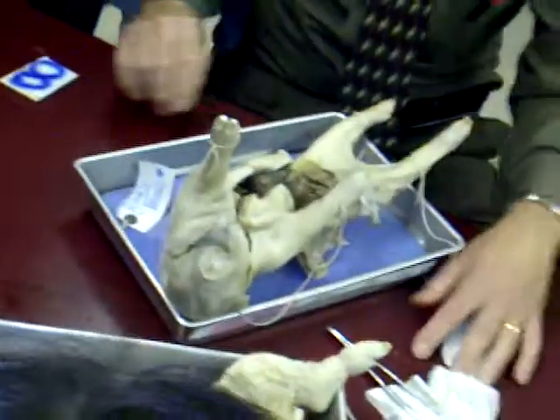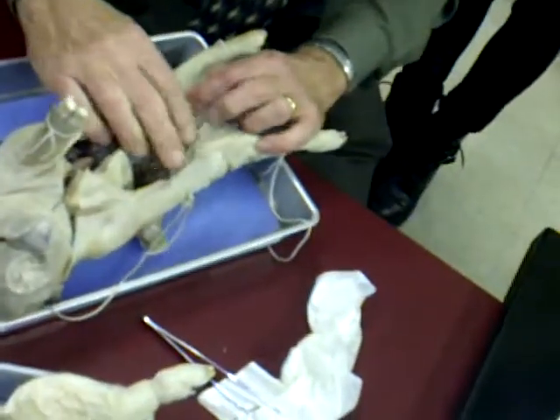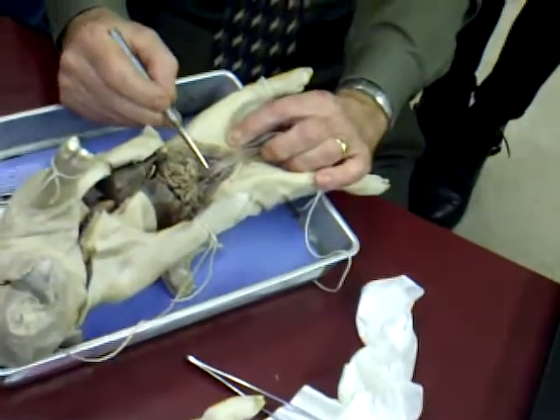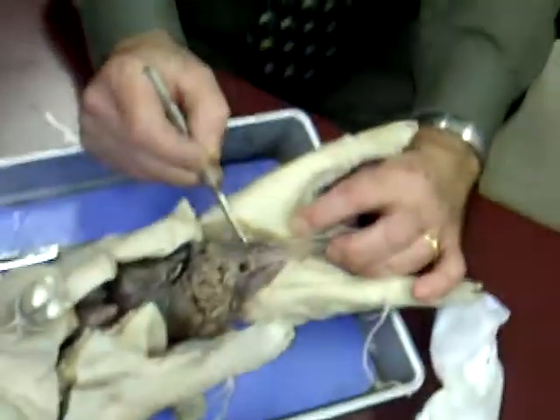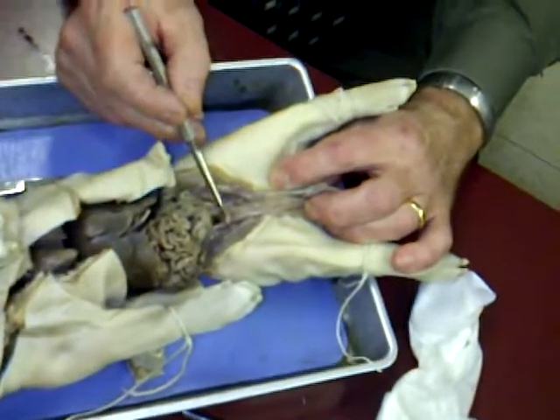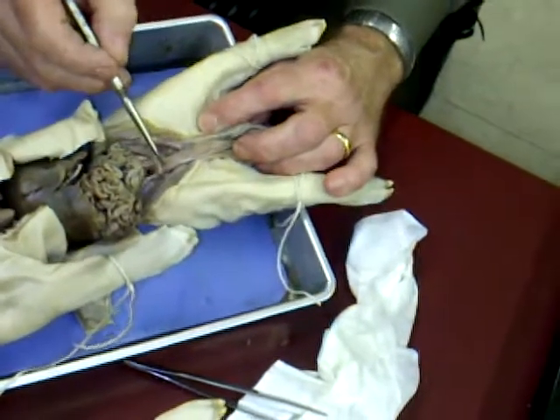Okay, we're going to be doing some more cutting here also. Now, with the testis, it's a little more complicated. First of all, notice how, if you look at the base of the bladder, it appears to be kind of already strapped in, like a seatbelt. You see that? That's actually not a seatbelt. Those are actually the two vasa deferentia, each one being a vas deferens. If you cut one of those, or both of those, you'd have a vasectomy.